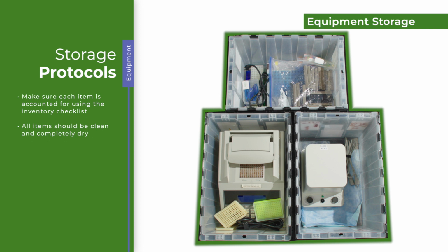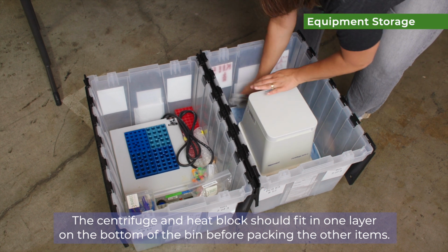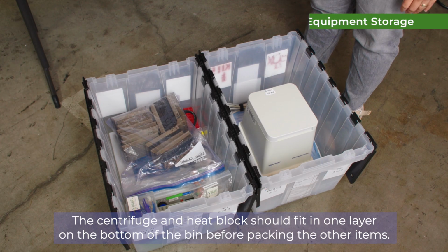When packing equipment back into the bin for storage, all items should be clean and completely dry. The centrifuge and heat block should fit in one layer on the bottom of the bin before packing the other items. This ensures the next teacher receives a complete and ready-to-go kit just like you did.